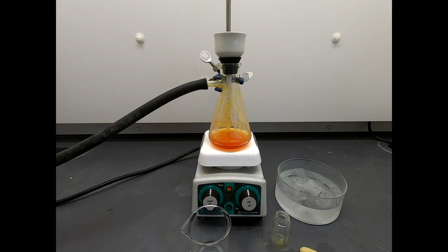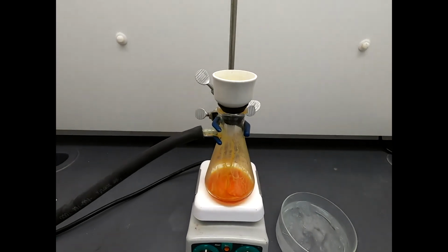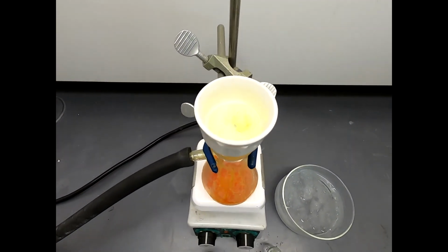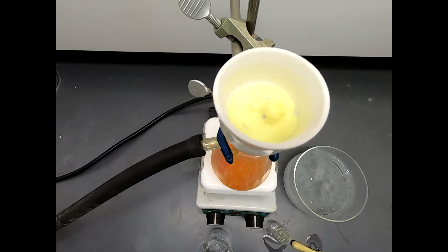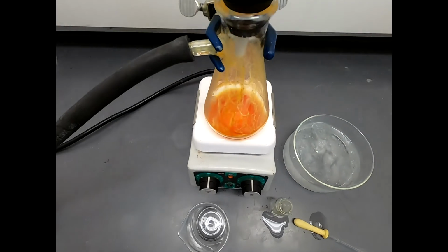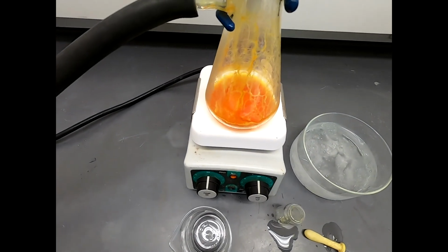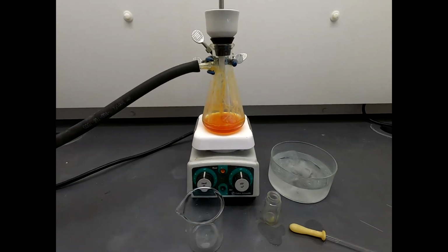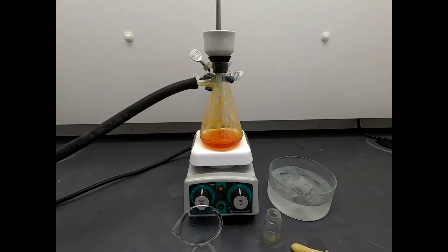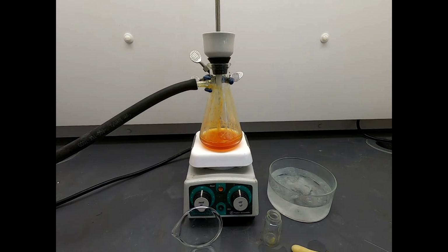So, I'll tell you what, before we cut off, let's go ahead and peek down in there. You can see it's got a little bit of a yellow tinge to it, not surprising, but that yellow tinge is certainly better than that deep orange color that we see in the bottom. So I think this looks pretty promising, but again, looking promising and being promising are two different things. So we'll just have to see what happens.